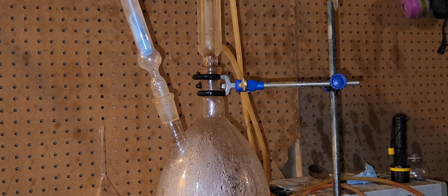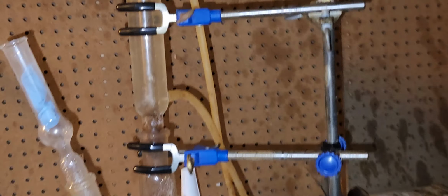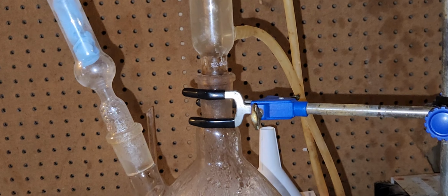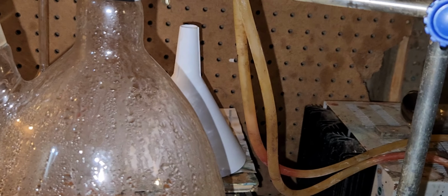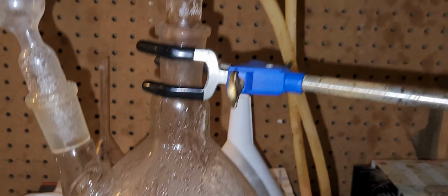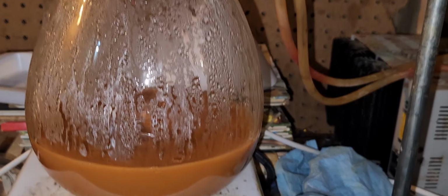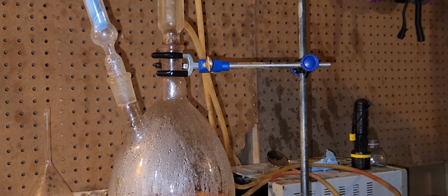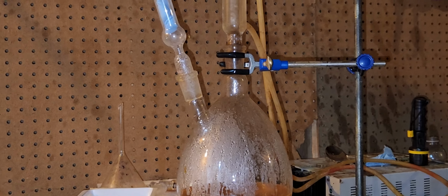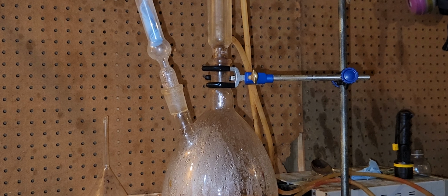Then you gotta deal with the vanadium in the flask as hazardous waste. Because any of that powder, remember, 1 gram per day exposure could be fatal for a few days, because vanadium is very toxic. MSDS level 4. They don't tell you that on the packaging, but you have to be very, very prudent with vanadium compounds. They are very toxic compounds. When I'm working with it, I wear a dust mask and gloves. Even though I can't wear gloves on this hand, I'm wearing them on the other one.